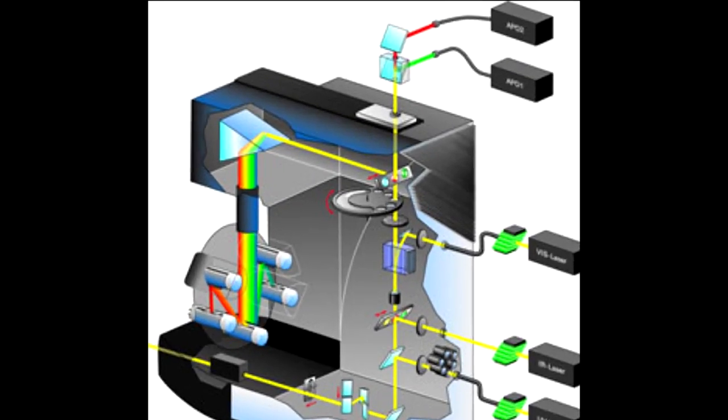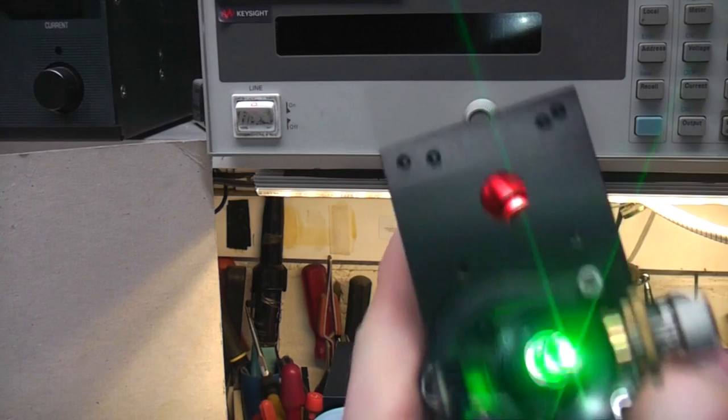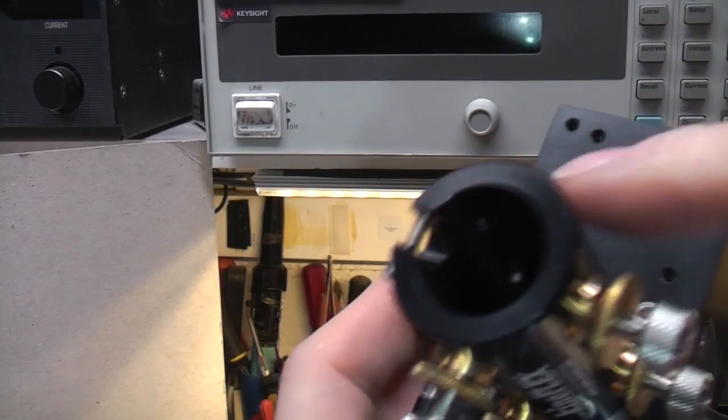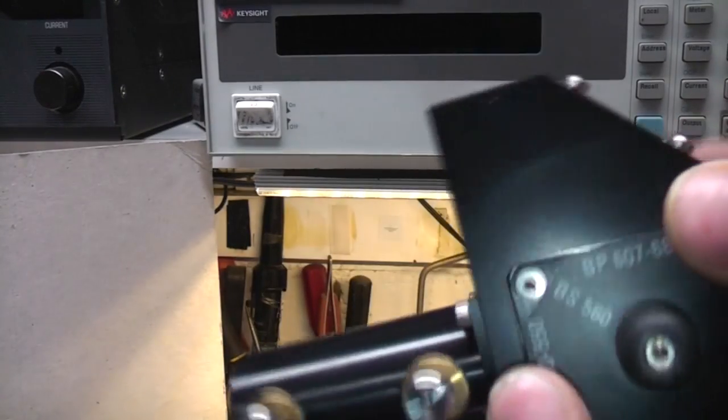Take this top bit, we can see this in the diagram which shows red and green lasers going in here, and if we shine some white light in the bottom we can see the red and green outputs. There's only one fibre coupler on there, but there's clearly a footprint here for a second one of these fibre optic couplers, so again that's an option that's not fitted.